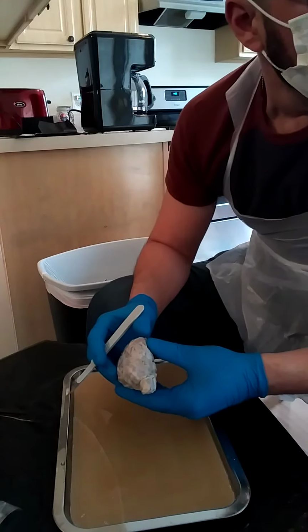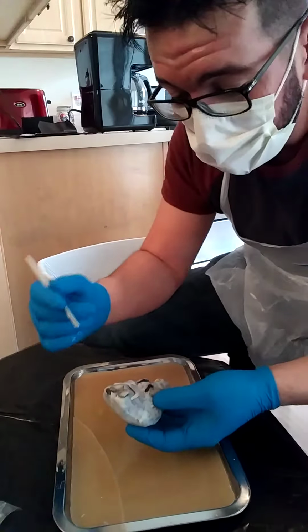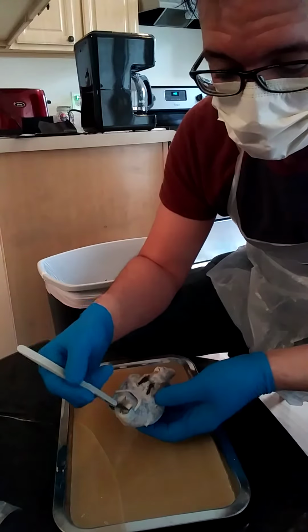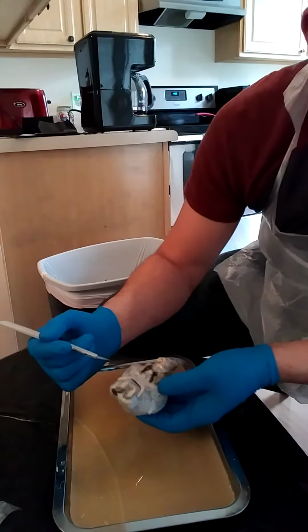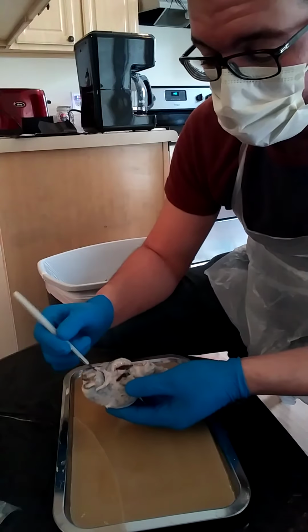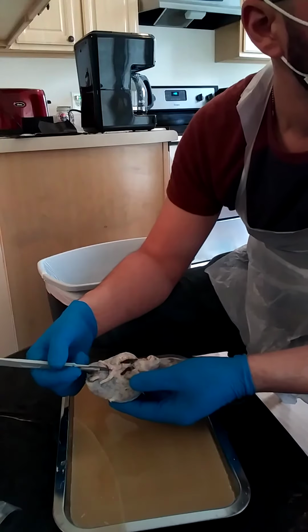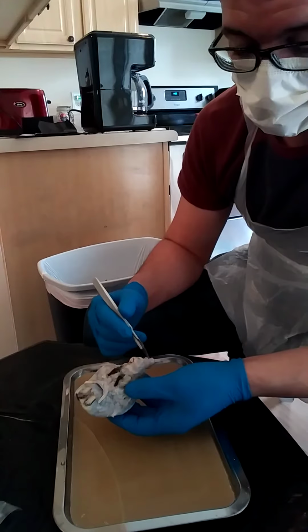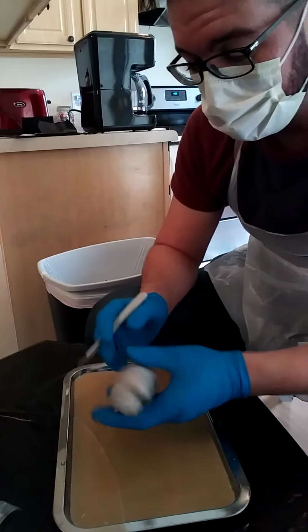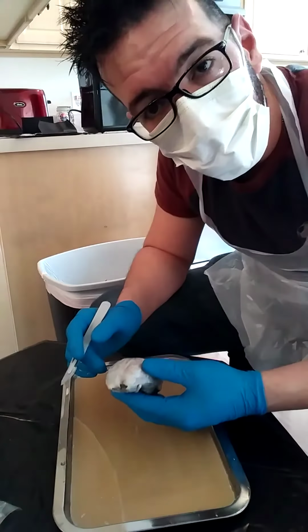Occipital. The olfactory bulb is, that's it, yeah. These are the olfactory bulbs, I believe, and this is for smell, if I'm not mistaken. After that we have the optic chiasm, which is the X part right here, the cross point at the bottom of the brain. The spinal cord is, or partially is, right here, as you can see. And then the cerebellum, which I've already discussed. So, that does it for the external parts. Let's cut this bad boy up and see what we got on the inside.